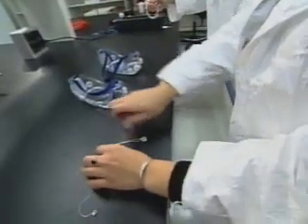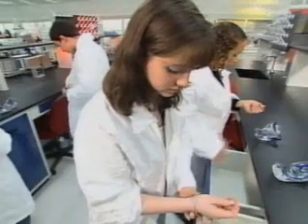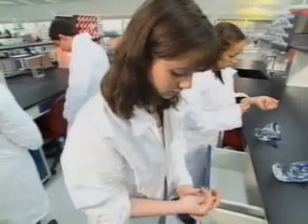Well, that all starts even before they get into the room, right? That's right, Mia. If you're going to participate in the Chem Games, you have got to be dressed for the job. Nobody should be wearing shorts or skirts or open-toed shoes. Long sleeves should be rolled up. Long hair should be pulled back. And no dangling jewelry. Heck, in my day, you got made fun of if you wore any of that stuff anyway. But it especially shouldn't be worn in the chemistry lab.